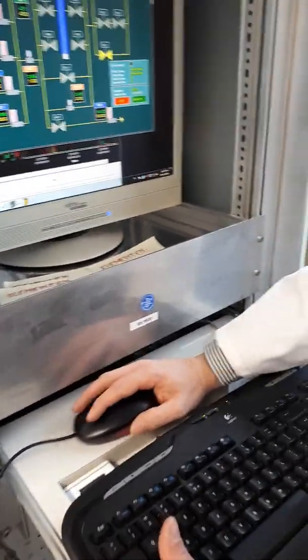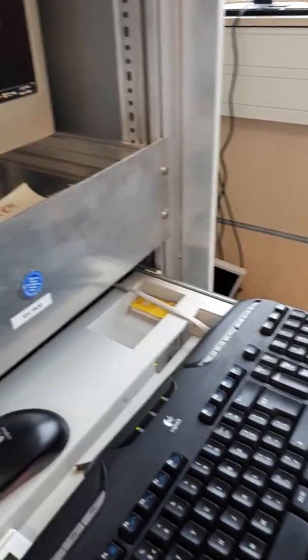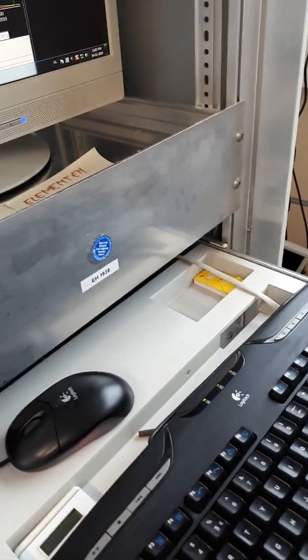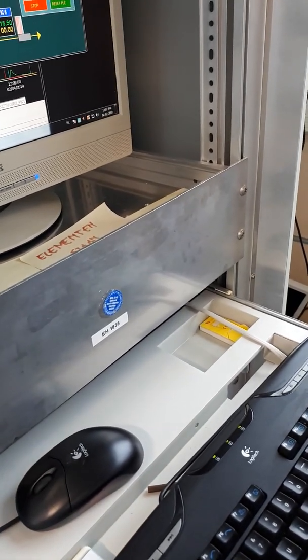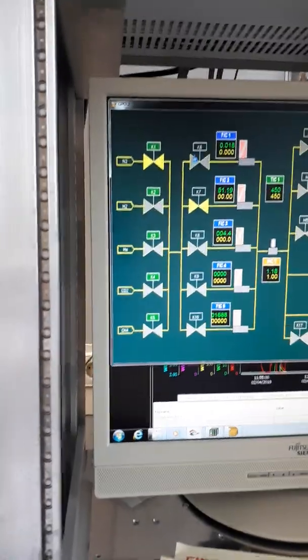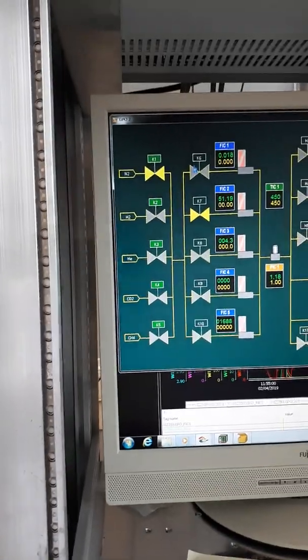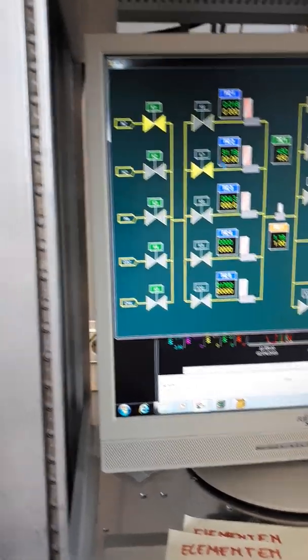I have a question here. We are giving one bar in yellow, and then the green line shows that the system is going to be one bar. But how much volume is flowing? We cannot judge from here. How much volume of the gas? What's the system volume? Or what is your flow in milliliters a minute that makes one bar pressure? How much flow of gas is required to make one bar pressure here? That's milliliters a minute.